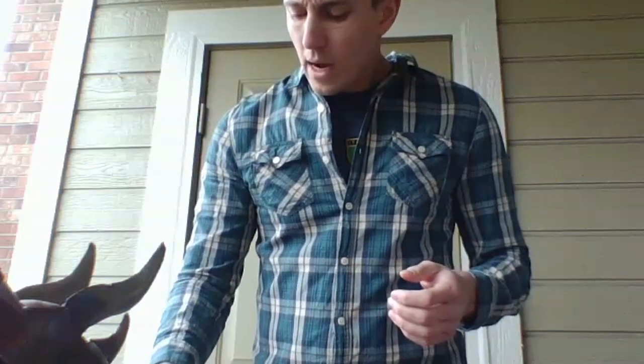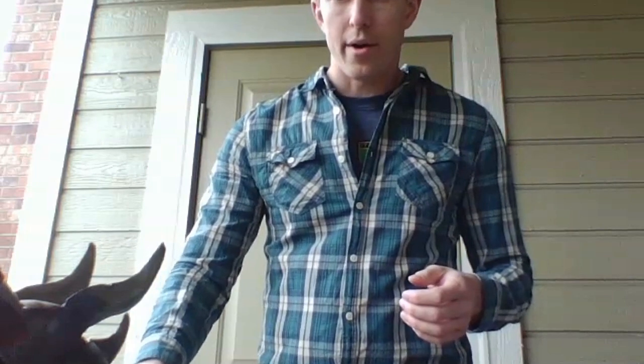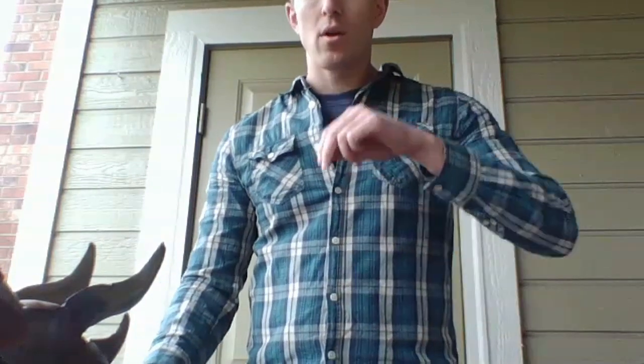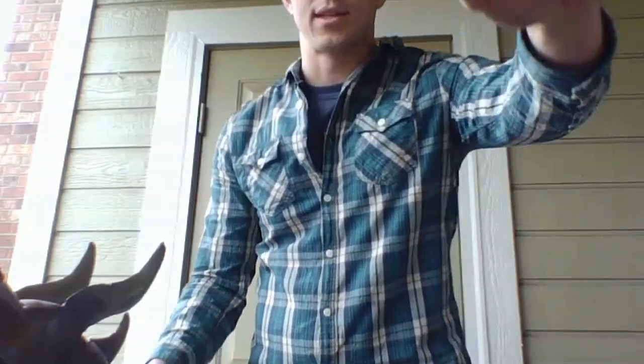So I'm going to get my fingers good and wet with this water here. And then I'm going to hold my fingers up essentially in front of my eyes, which I realize is a little bit off the screen, so let me push that back a little bit. So I'm going to hold it right in front of my eyes. Now notice how I'm holding it straight down. To be honest, when I was holding it like this, the drops sometimes didn't come out, and you don't want to move your finger up and down. You want it to be completely fixed. So I'd recommend holding your finger still like that.